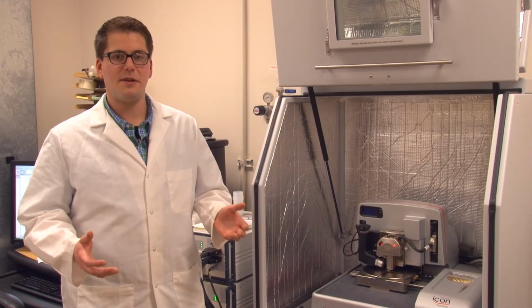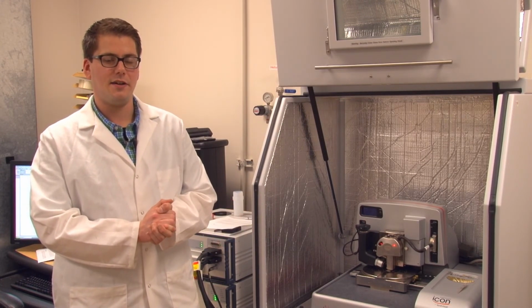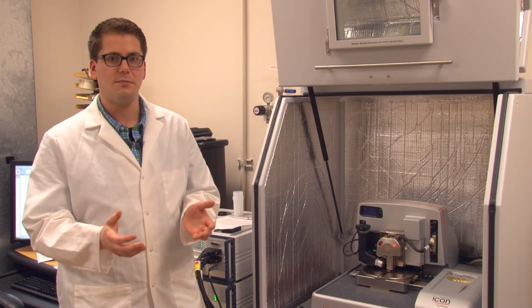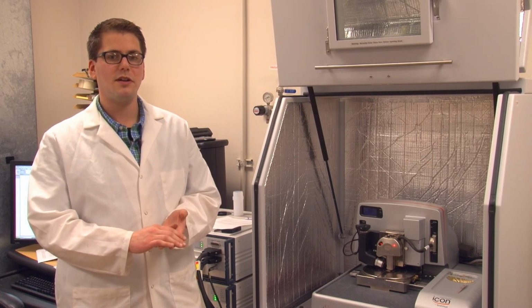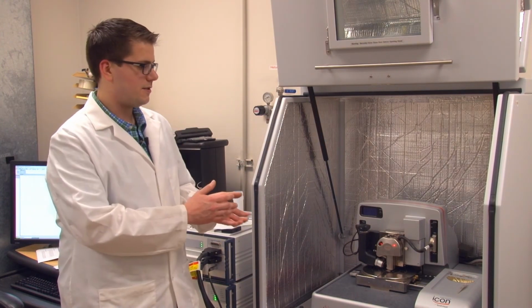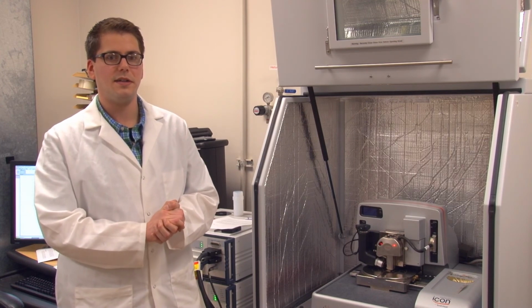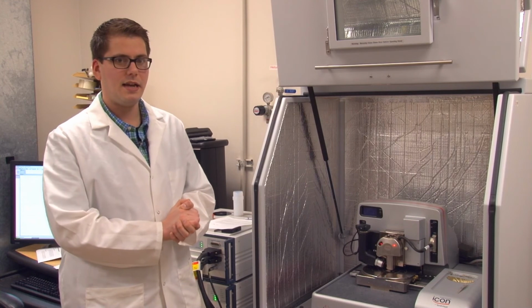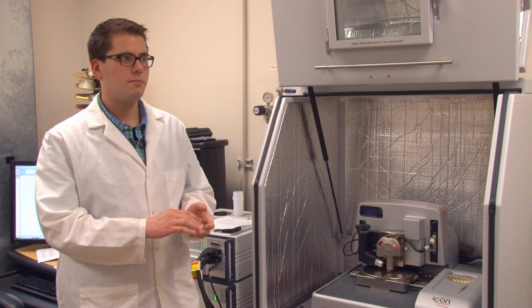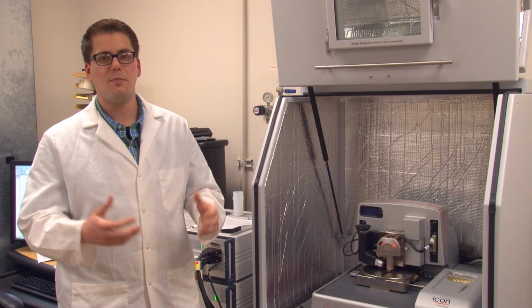The determination of nanomechanical properties by AFM is useful for us in our nanofocus area at ERDC because it allows us to assess the characteristics associated with a wide range of films. The technique is particularly applicable to softer materials such as biological films and cells, but we've also demonstrated its use on soft metals. We've looked today at gold in particular, and can apply the technique to a whole host of materials that we're interested in, from cells, biological samples, to more complicated systems such as hybrid or composite materials.